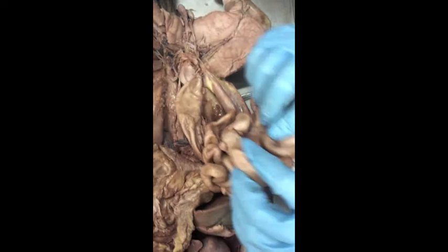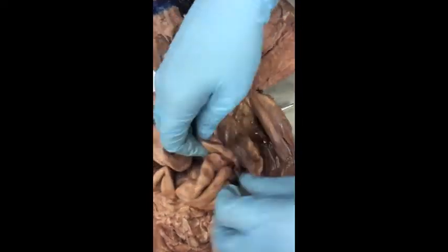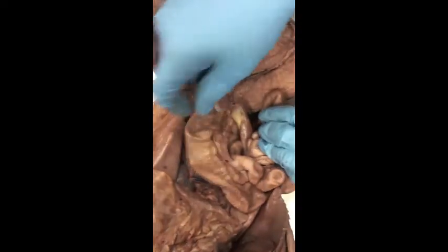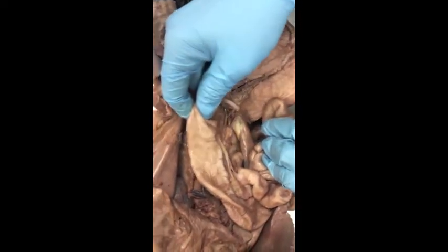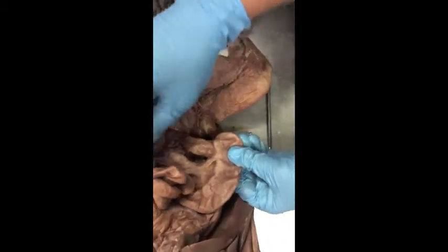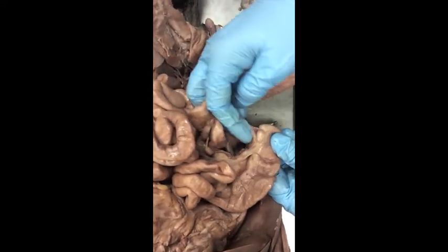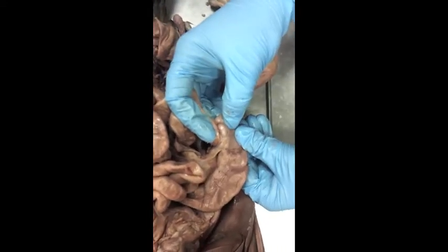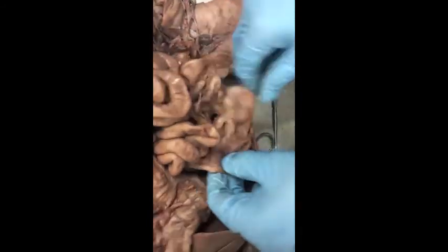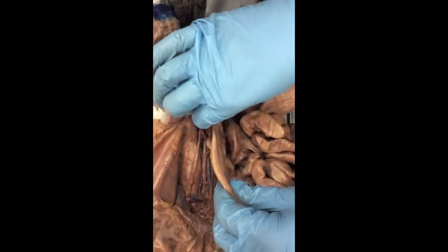Now, we're not going to worry about exactly where that distinction occurs, but what we're going to do is find our cecum of our large intestine. So sometimes it's easiest if you start at the rectum end and work your way back. So here's our cecum. So here we can see the last part of our small intestine, our ileum, connecting in right there at the cecum. And then from the cecum, this is all colon until we get down to the tail end of things where it becomes the rectum.